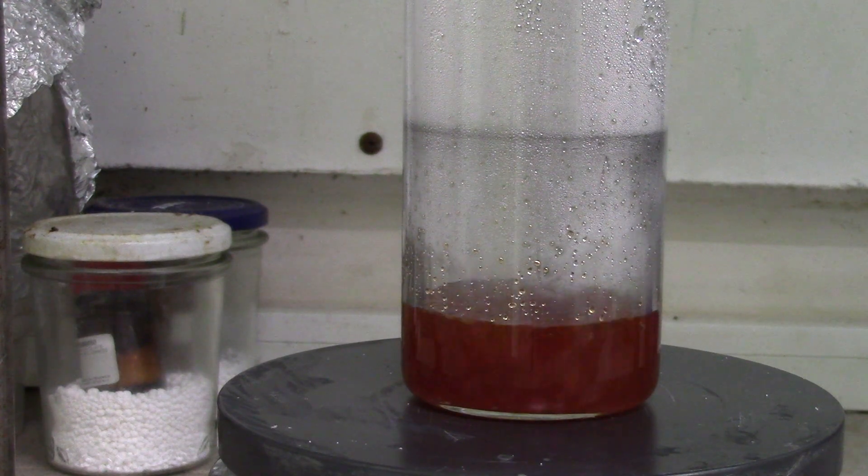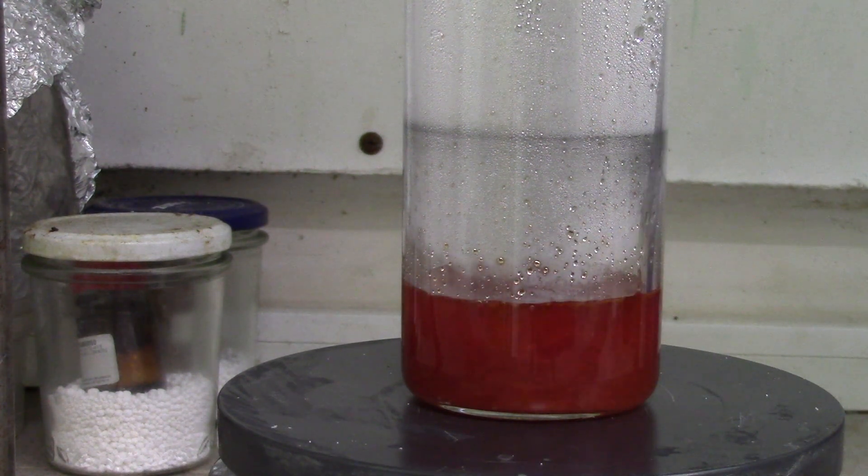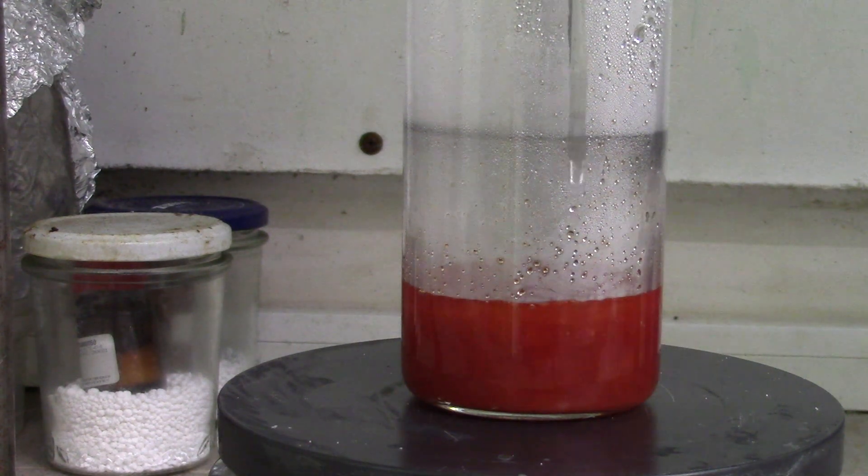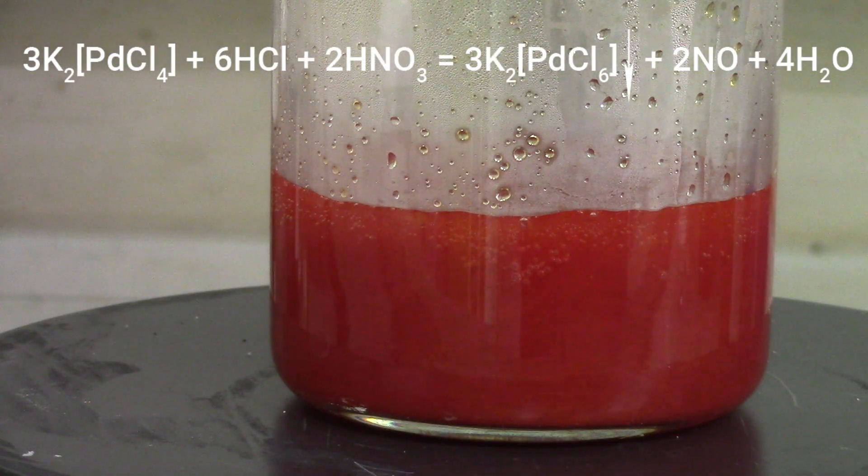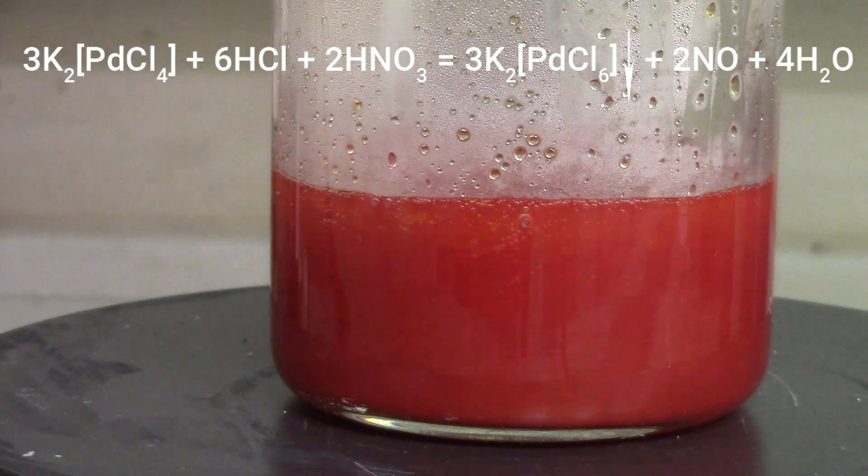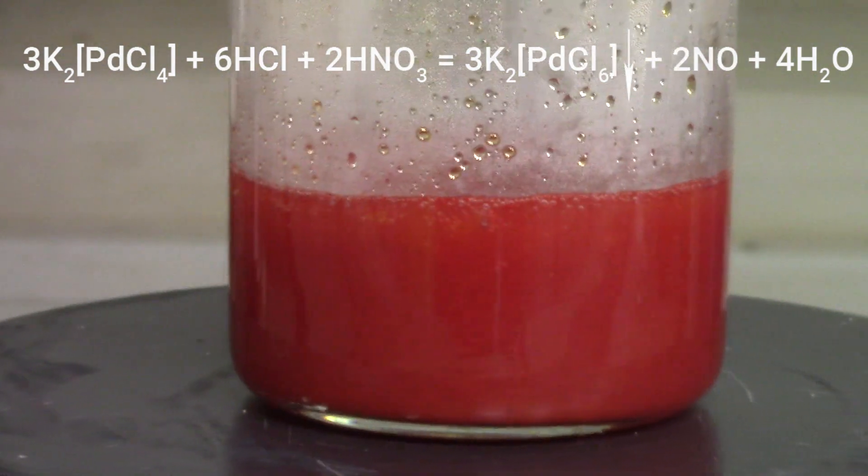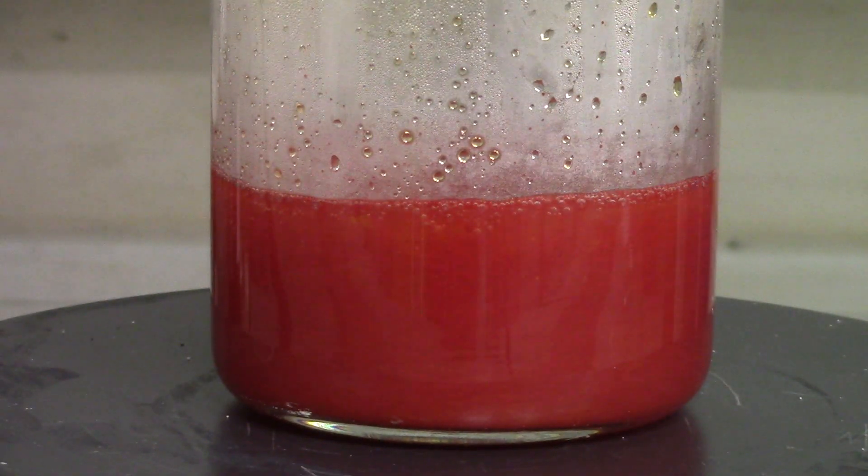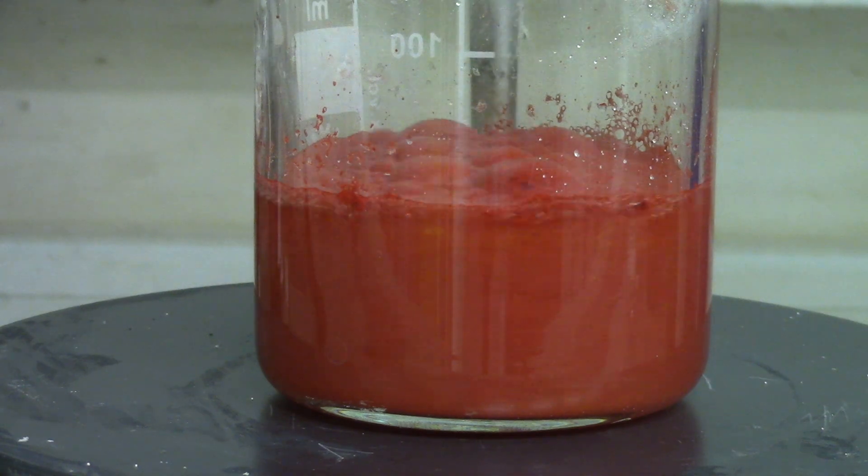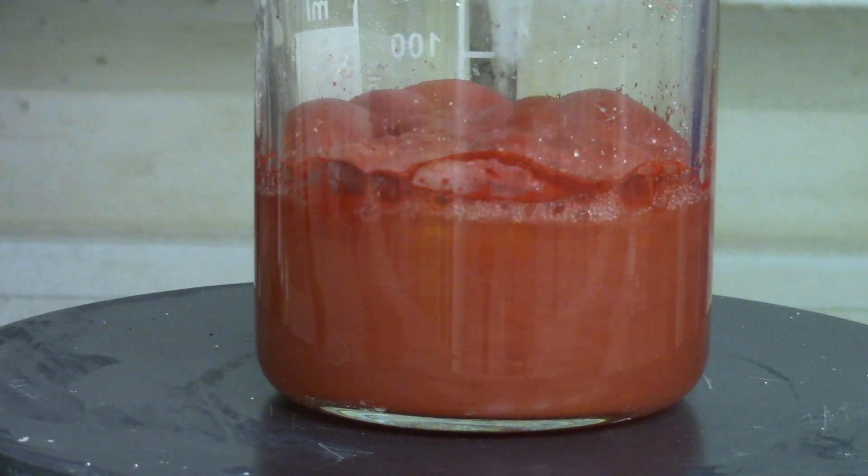In this reaction you can watch how palladium +2 is converting into +4 oxidation state. It precipitates as non-soluble potassium hexachloropalladate. Such a vigorous nitrogen dioxide is going out.